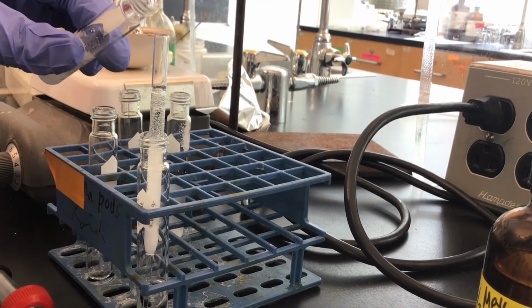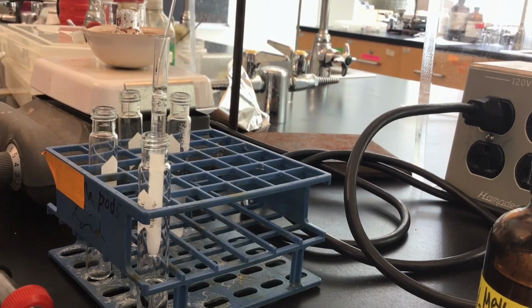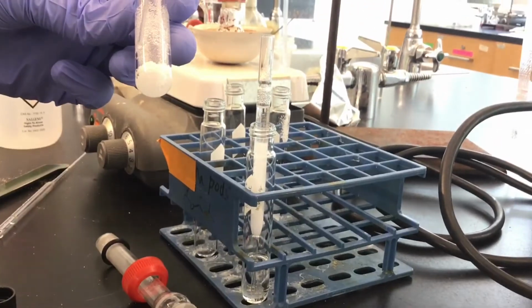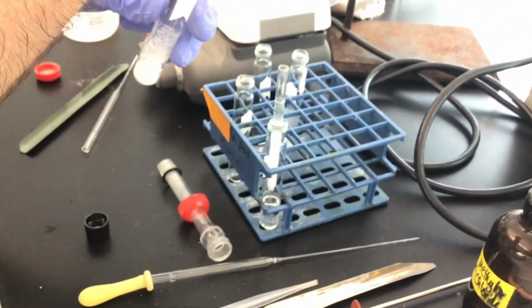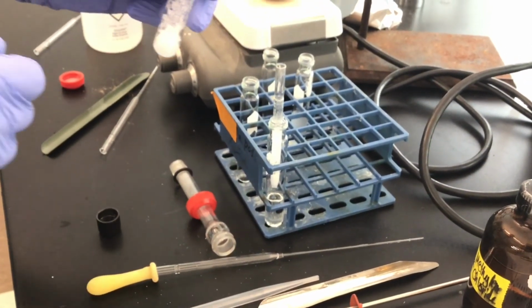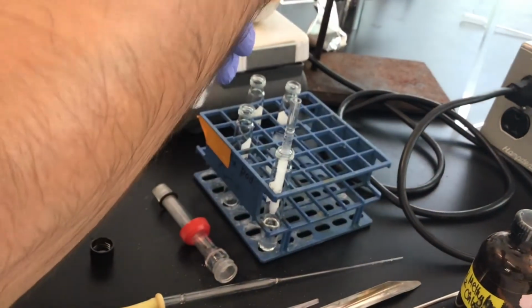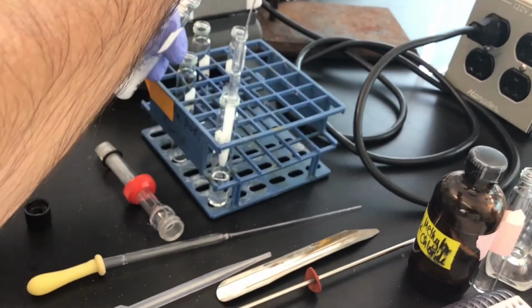All right, now here's the remaining. And then you can see that I've got the remaining sodium sulfate left, and we're not really getting much left, right? It's like at the bottom of your soda when you're being rude and trying to slurp it up. If you were being very efficient in terms of quantitative transfer, you could use a little bit more methylene chloride to rinse everything and then try and get everything over. But we're going to do it this way.